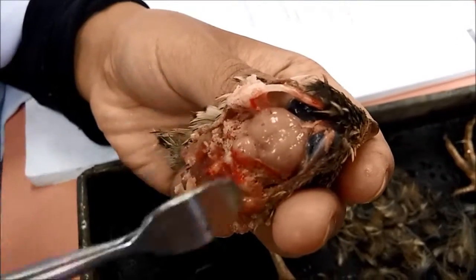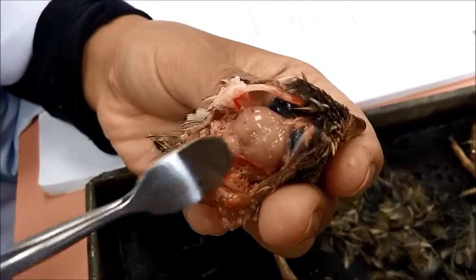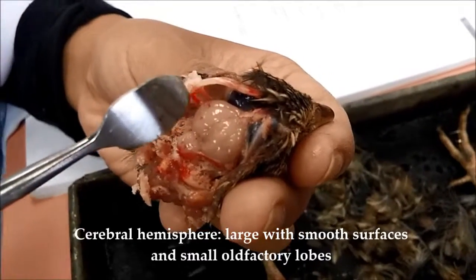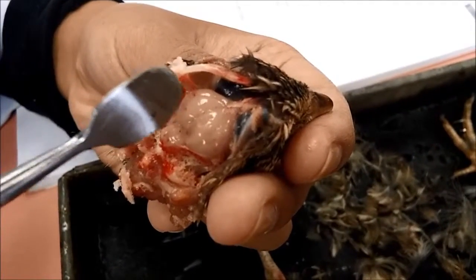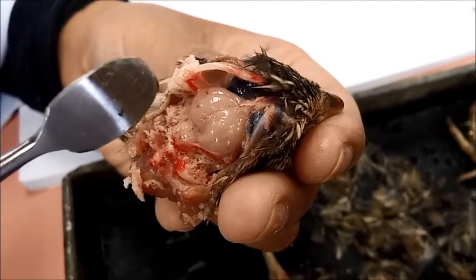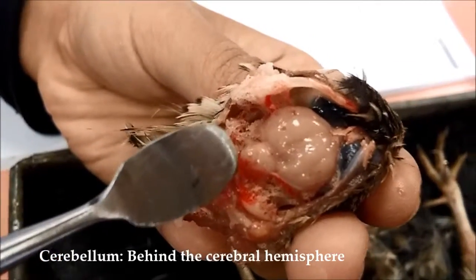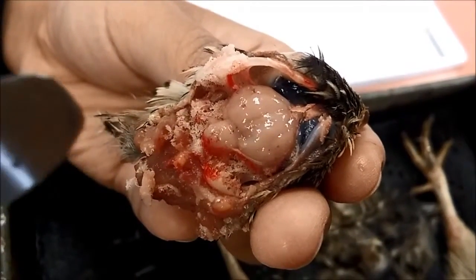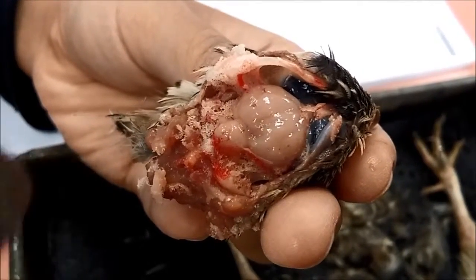So basically, we can identify the regions of the brain from the dorsal side. So firstly, we can see this is the cerebral hemisphere. It is large with a smooth surface and small olfactory lobes. And then the second thing is the cerebellum. So the cerebellum is here. Basically, the cerebellum is behind the cerebral hemisphere with deep ridges across it transversely and a floccular lobe on the other side.